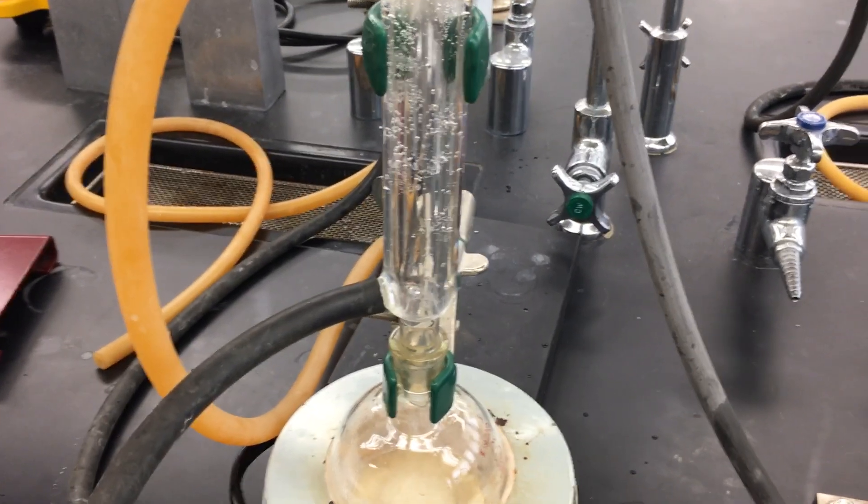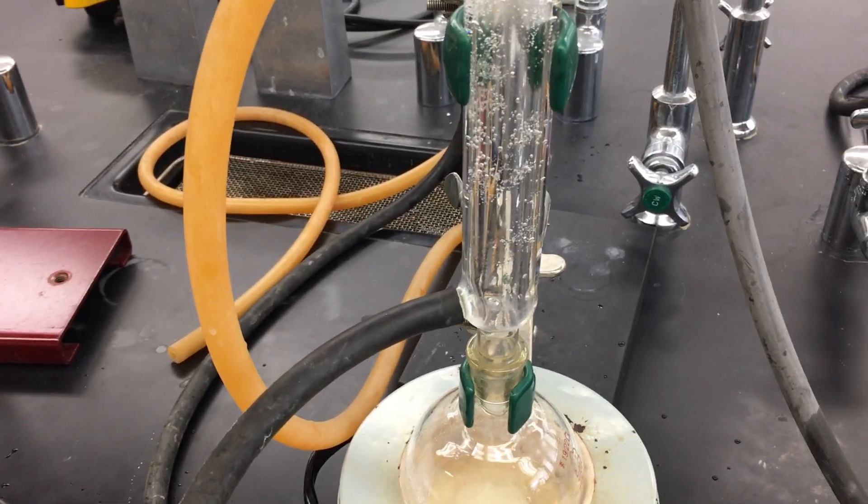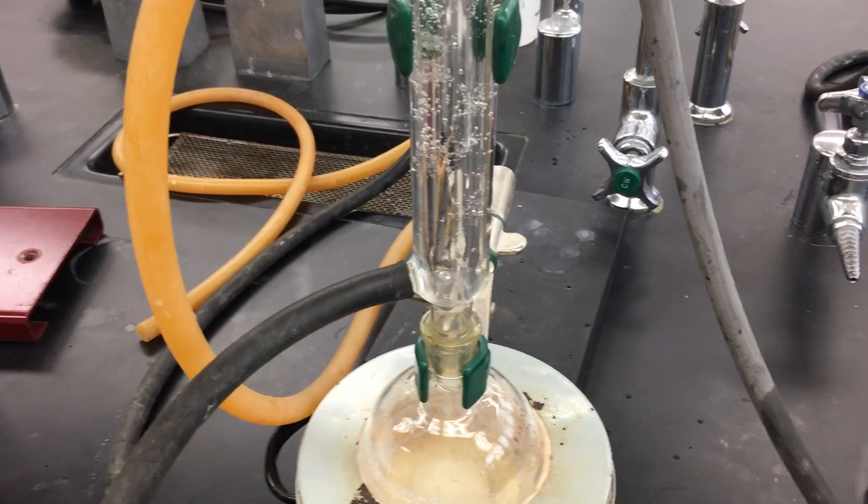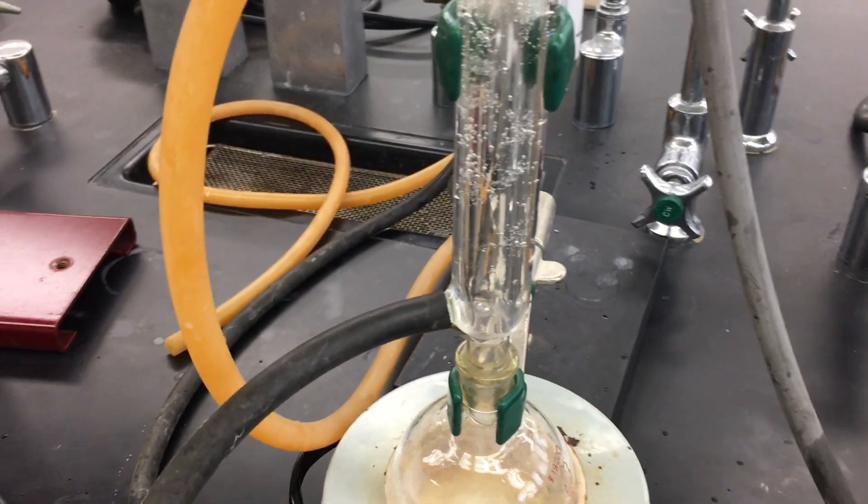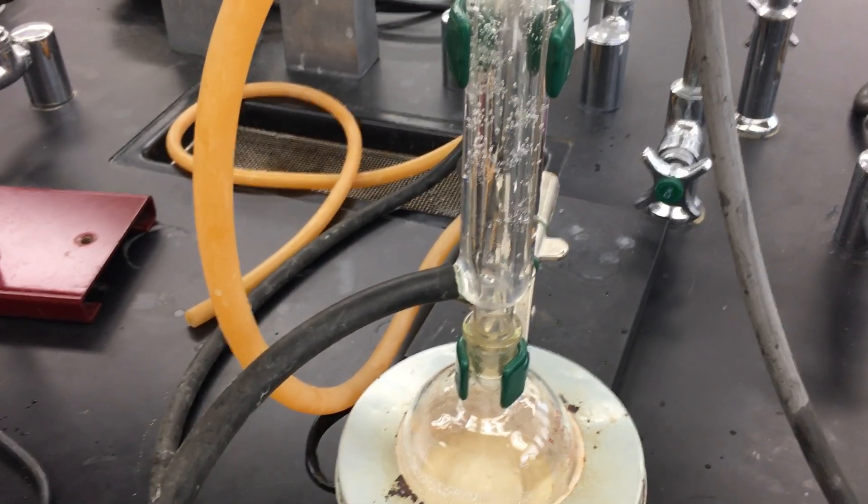Once this step is over, the rest of the steps, which include the first distillation, the extraction, and the second distillation, are all the steps necessary in order to purify and isolate our product.